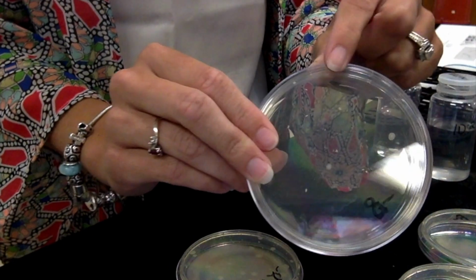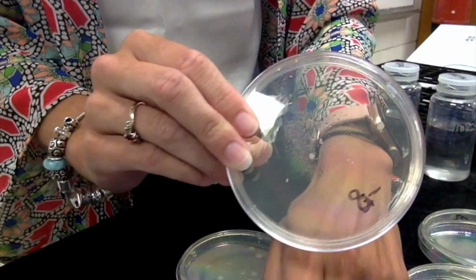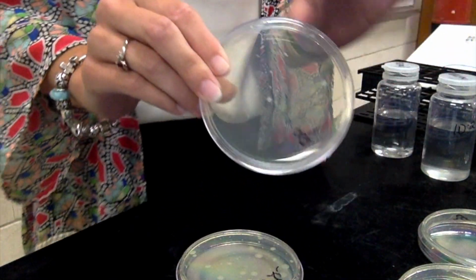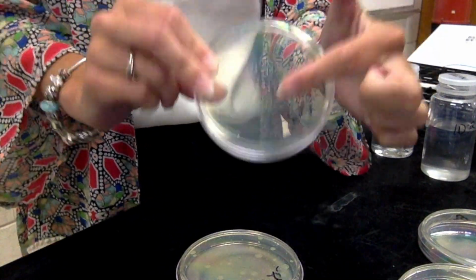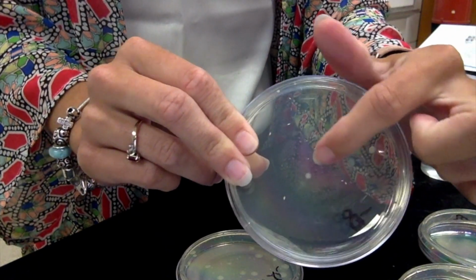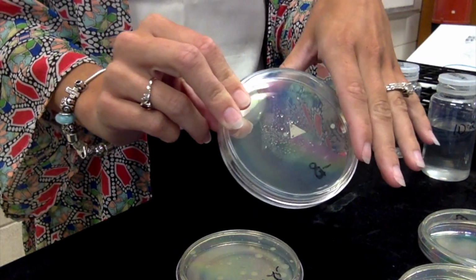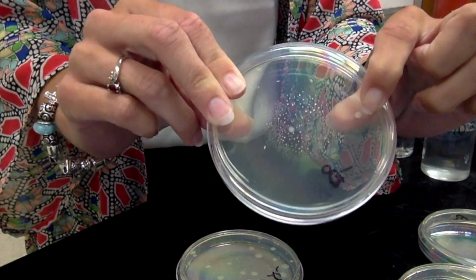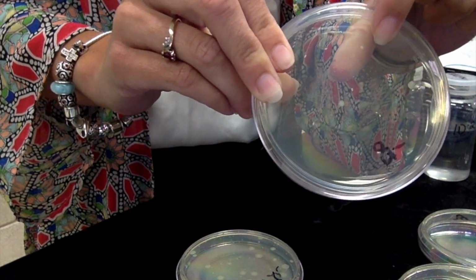And if you notice, there's 2 different kinds of colonies. There's ones that look like normal colonies, and then ones that look like little grains of rice. Those are both the same thing. They're both E. coli colonies, but the difference is where they're growing in the media. The ones that look like little grains of rice are growing within the media, because remember we mixed this together with our dilution. The ones that look like regular colonies are growing on the surface of the agar. So that's where the difference comes in, but you count both of them.